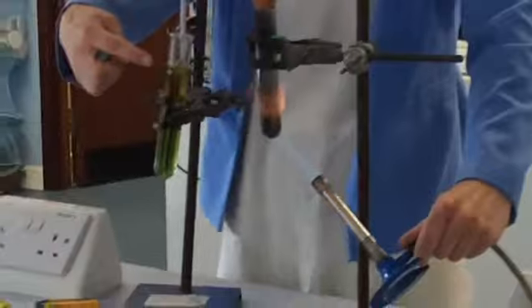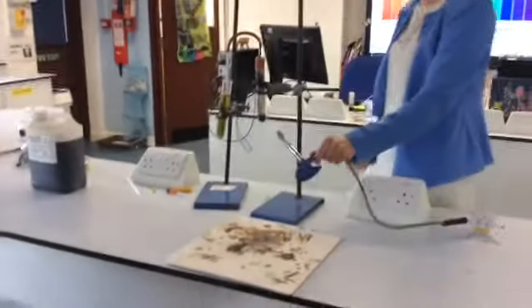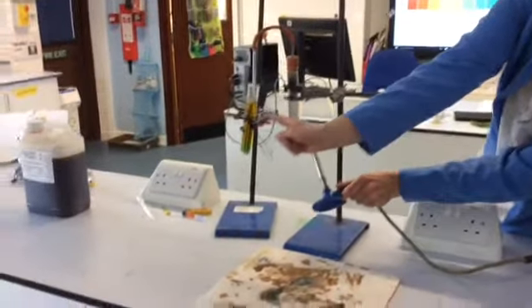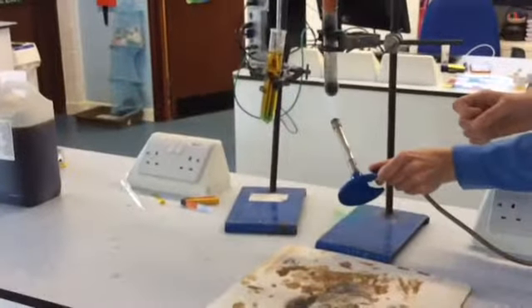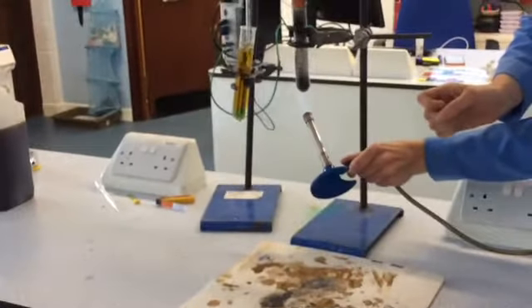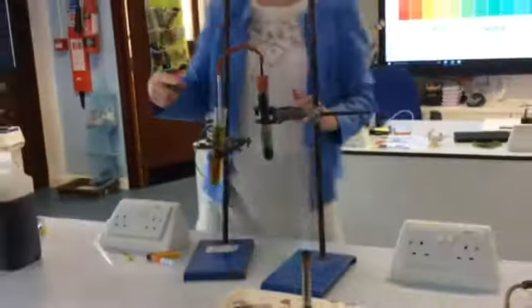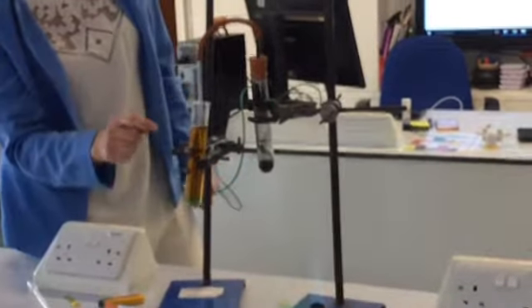So you can see the carbon dioxide bubbling through here now, and you can see it's already starting to change colour, hopefully. It's now green. Can you see at the bottom it's still green, but it's gone yellow at this bit here. So we'll keep sending as much through as we can. Oops. And now it's turned back to green because I've sent too much through. I heated up too much, and you can see the actual copper oxide has gone up through the tube, and now it's gone back to yellow because I've taken the heat away.